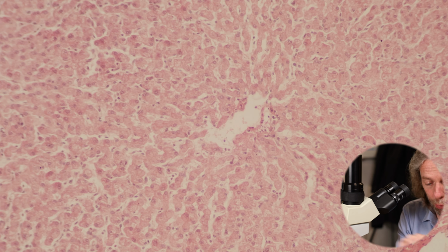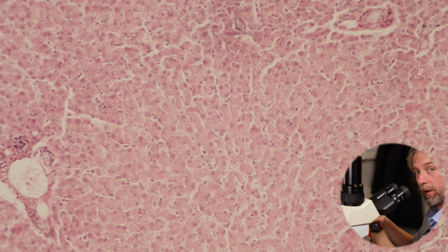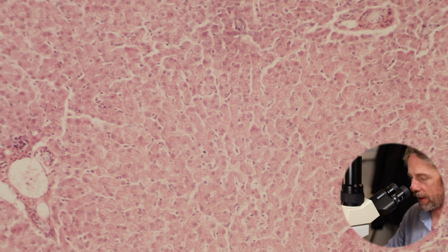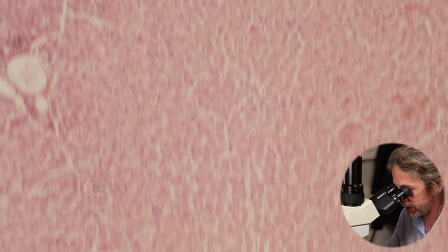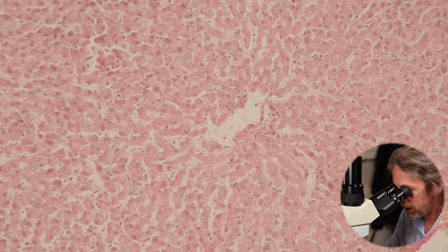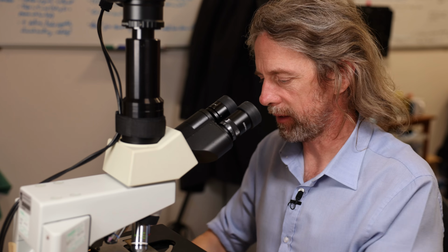So of your row of hepatocytes, on one side they're working with the blood, and on the other side they're putting out bile. So the bile canaliculi, the little canals carrying bile, are on the other side to the sinusoid. All right, if I zoom out, let's try and see these hexagons.